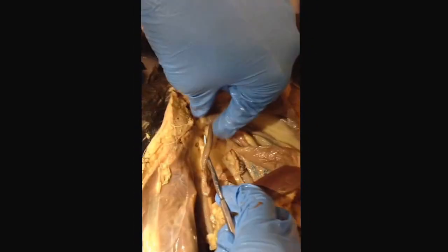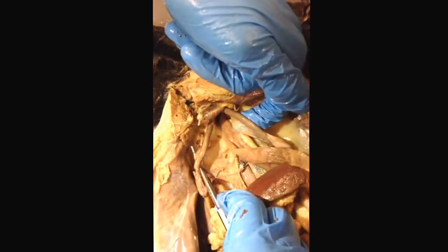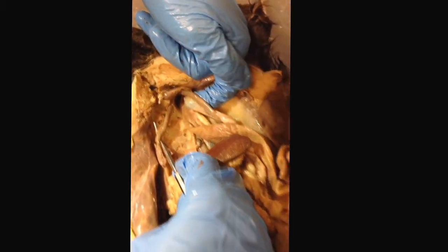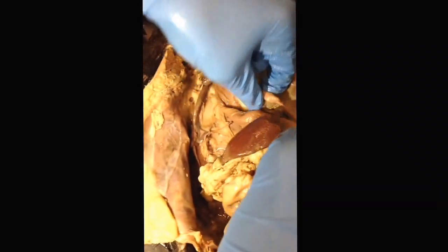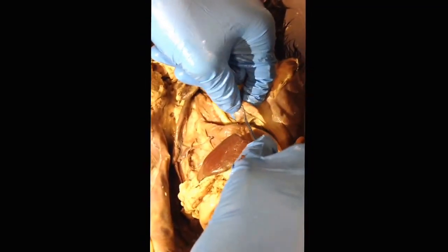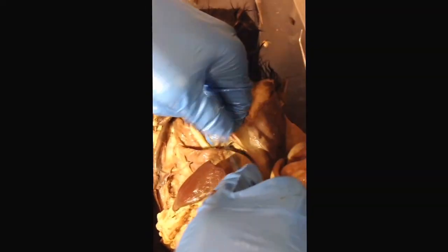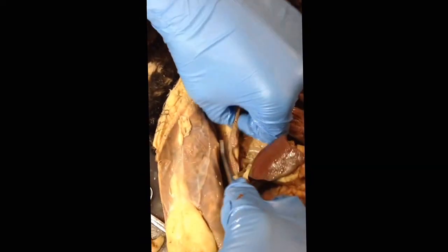And horn of the uterus, there's basically two different tubes that connect to the body of the uterus. Not to be confused with the next thing on the list, which is the ovary. And the ovaries are the two bumps, or the two little masses of tissue, flaps of tissue on either side on the two individual horns. And let me get a better angle there, and you can see them pretty easily.